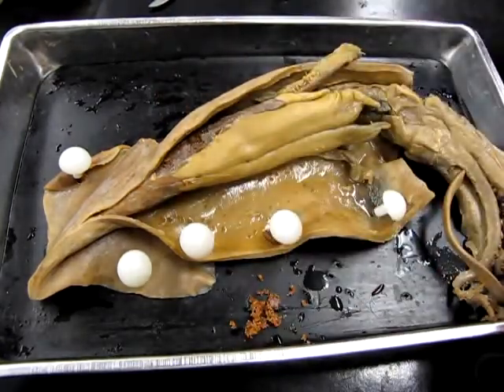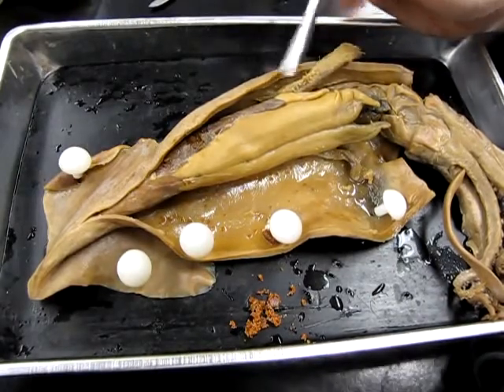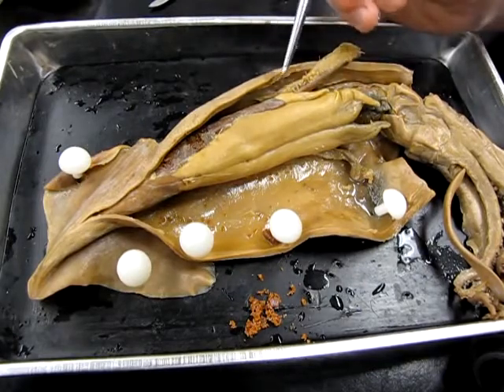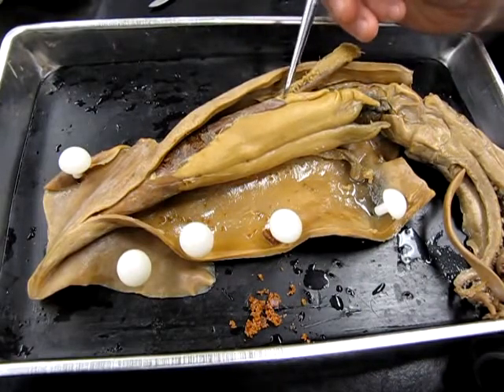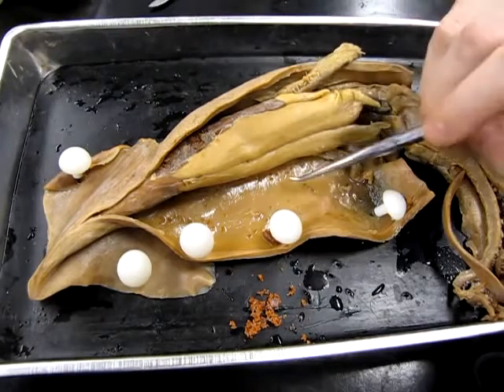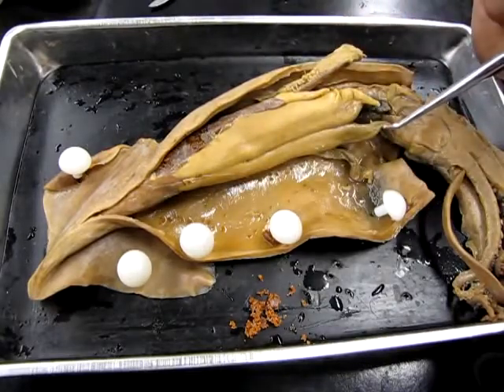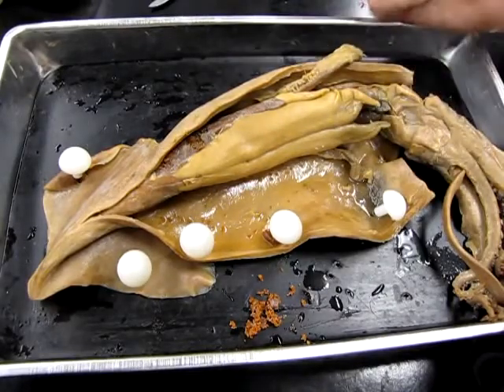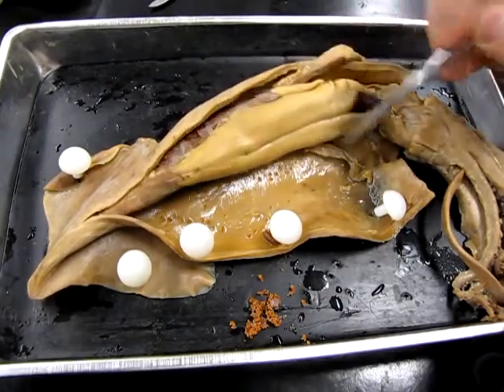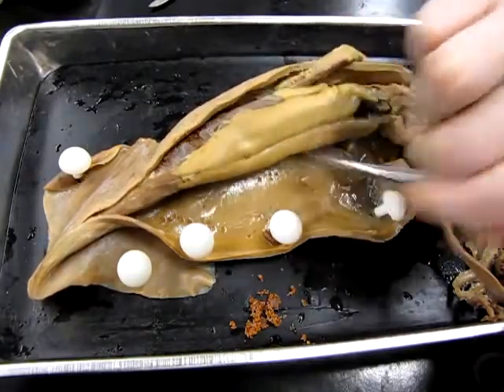Okay. Down here we have a small accessory gland that's called the oviductal gland. This actually produces the shells that go on the egg. So this creates the egg shell. There is an oviduct through which the ready-to-go eggs would pass before they were released. Unfortunately, in this specimen, without really taking her to bits, it's not going to be immediately apparent. It's buried under some of the other structures here.